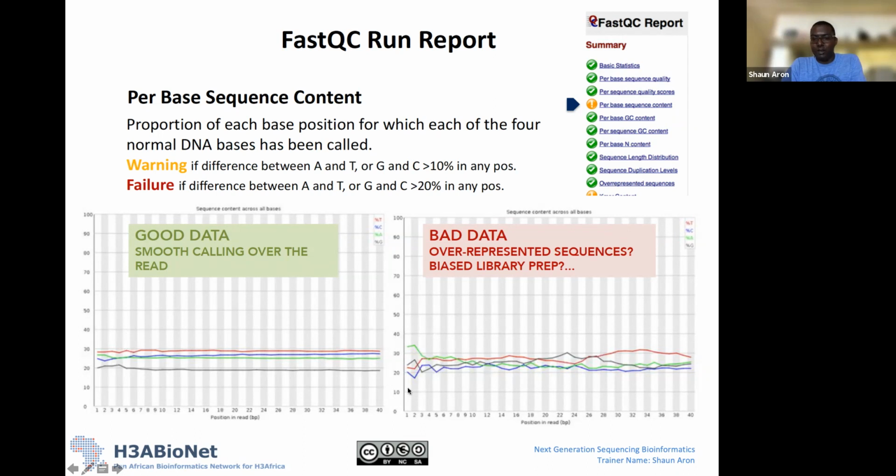For example, here you'll see it's very noisy at the beginning. That's just because these bases are usually not accurately called. As I mentioned before, we usually have low quality calls at the beginning, and it evens out as you go through the read. So essentially what we're looking for here is consistent, smooth lines at a reasonable percentage. Depending on your organism, this might change, but this is sort of a reasonable region. I think this is human data.